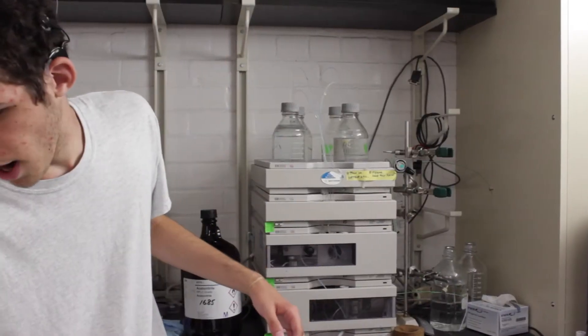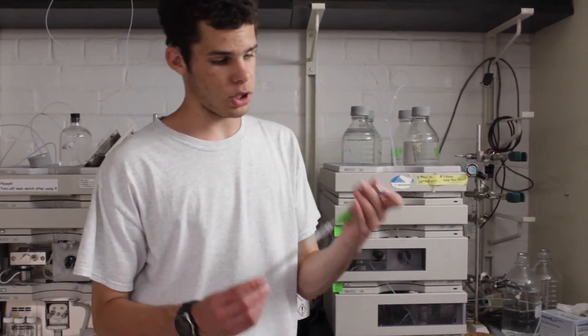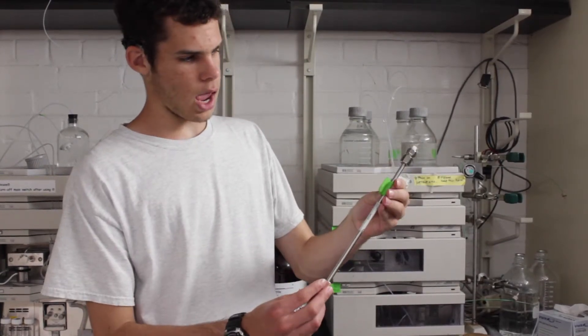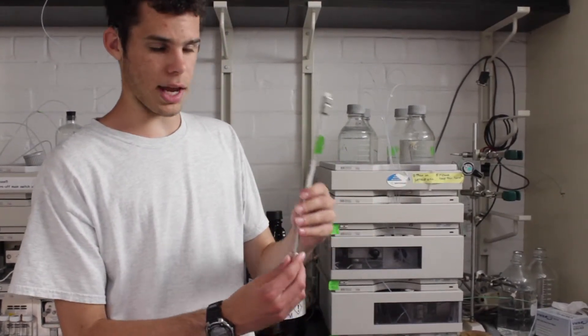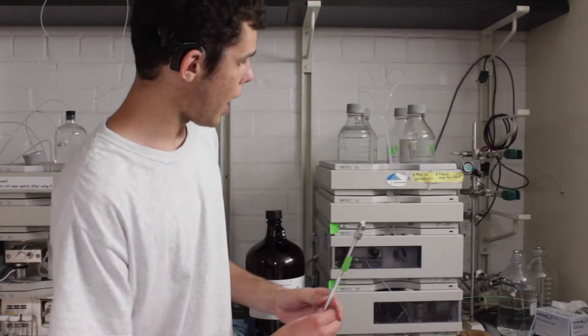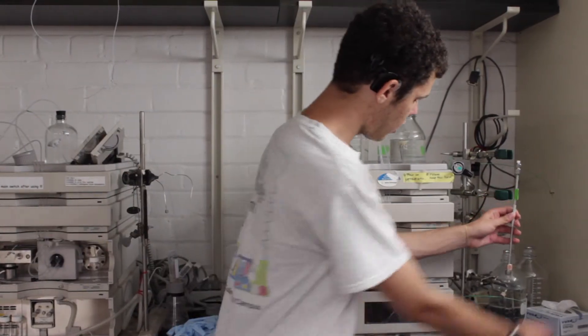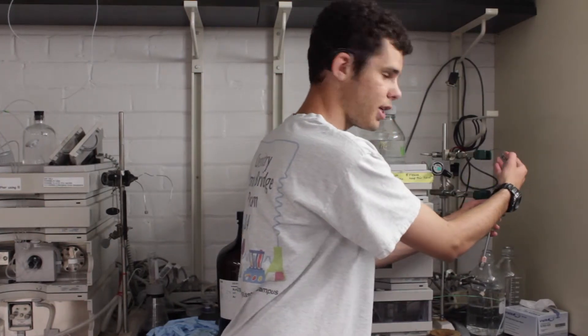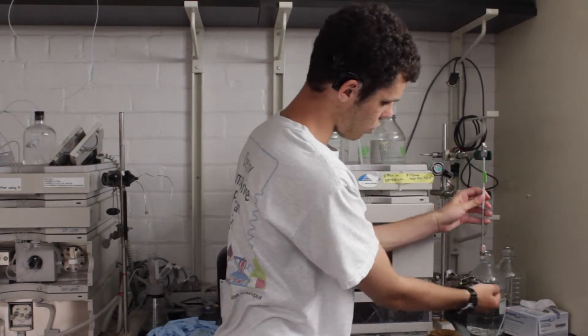Really, the question that we're trying to answer is how successful were we in making this peptide? Once we've purified the compound, we'll be using this. It runs from here to here. This is called the analytical column. We'll put it here, this will connect into here, and this will connect into there.